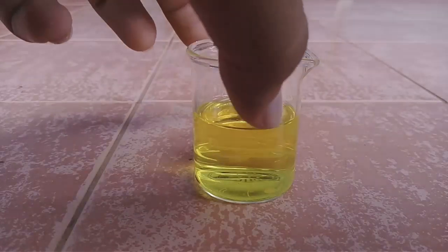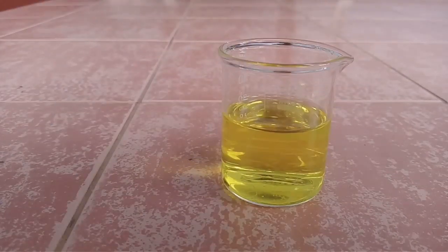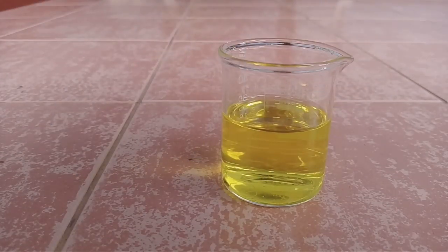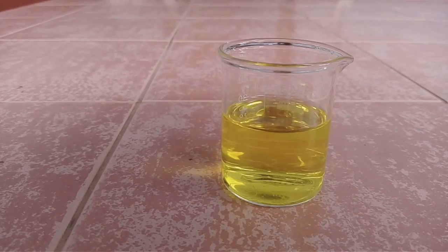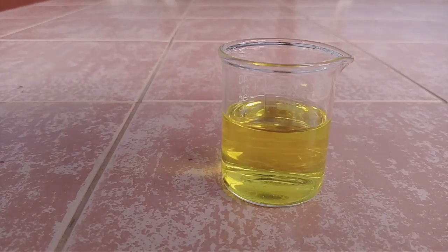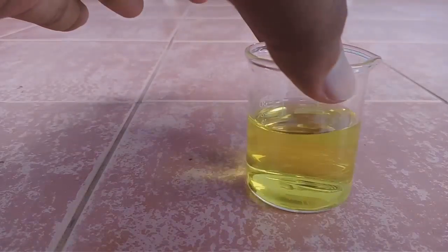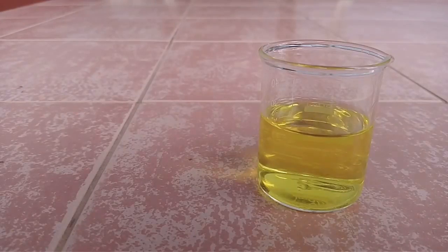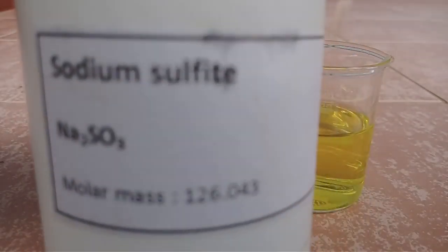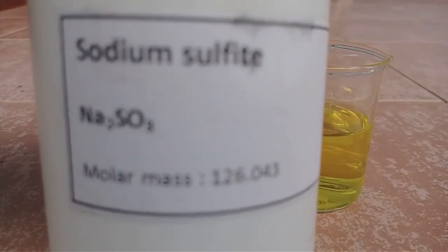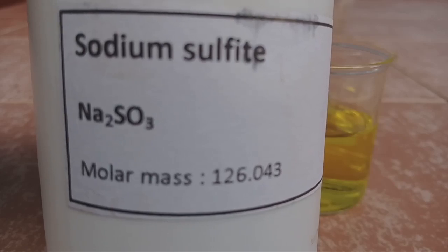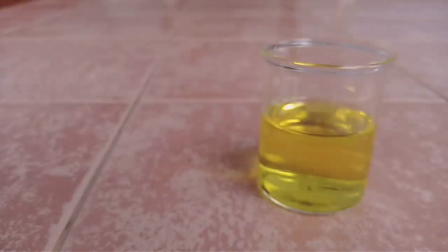Here is the gold solution. You must be careful when you handle this gold solution because these gold solutions are very toxic. Now I am going to add sodium sulfite.